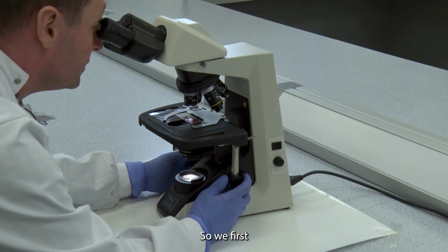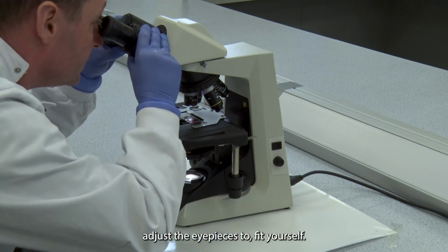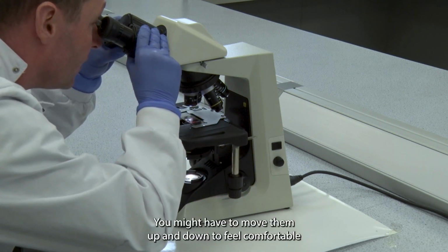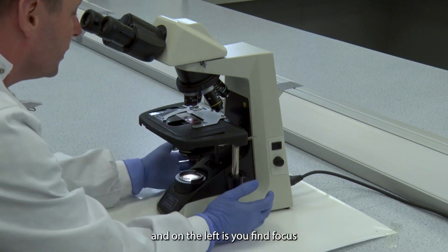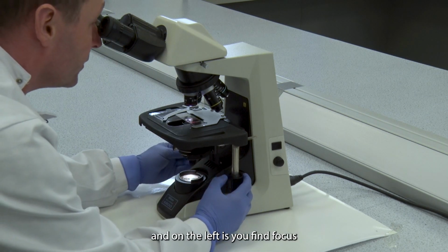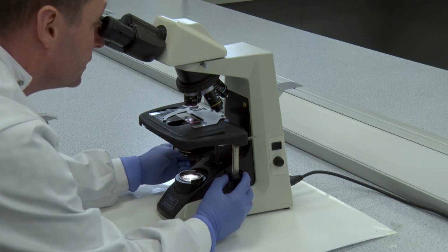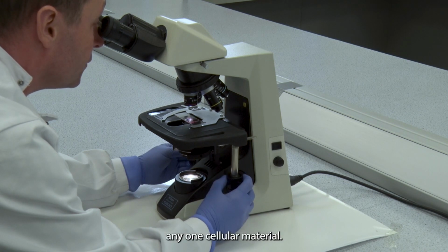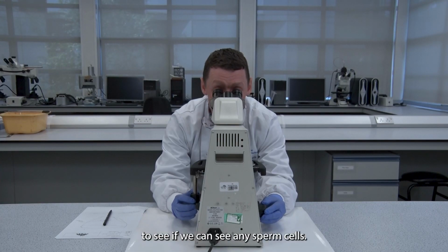So we first adjust the eyepieces to fit yourself, so you might have to move them up and down so you are comfortable. And on the left is your fine focus, and then you search the slide to see if we can actually see any cellular material, and secondly, in this case, we'll want to look to see if we can see any sperm cells.